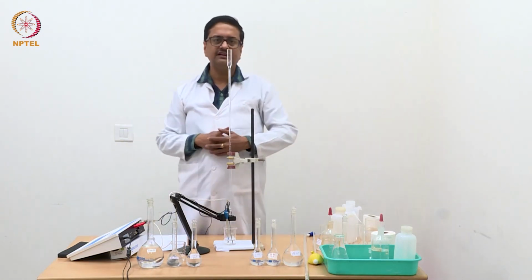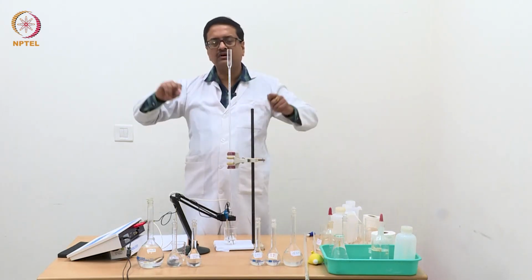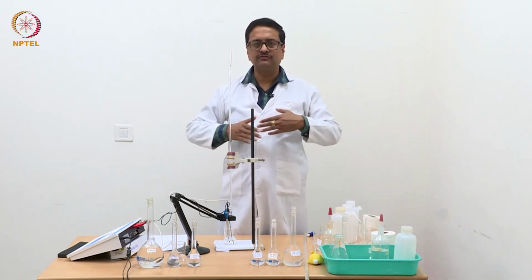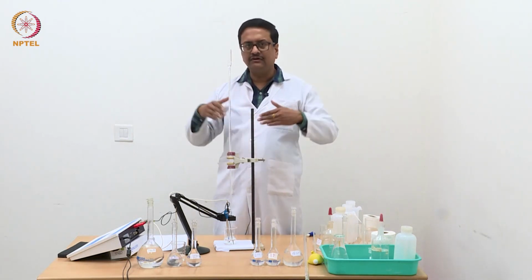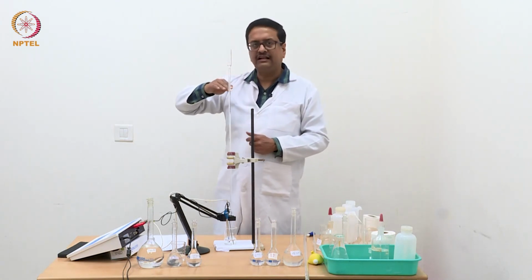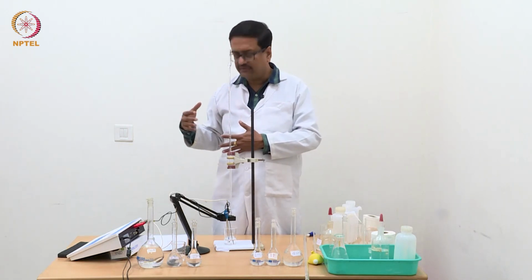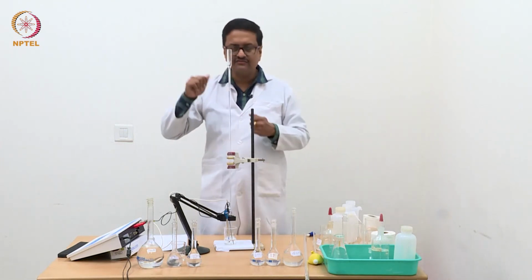These points which are very close to the neutralization point, we need them very accurately to draw the actual graph, but these points will not be useful for finding out the end point, as you know that we will have to draw a tangent through all the points which are falling in the straight line. So when we do that, we will see that these points which are slowly changing from constant to an increasing trend will not fall in the straight line. So we will not need these points for accurate endpoint determination, but to show the trend of how it changes, we will need these points.